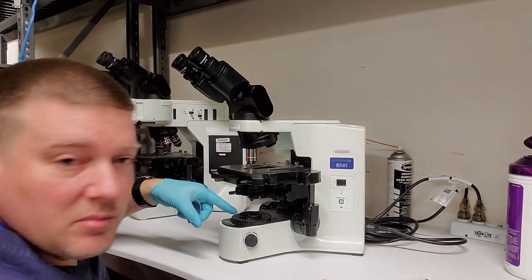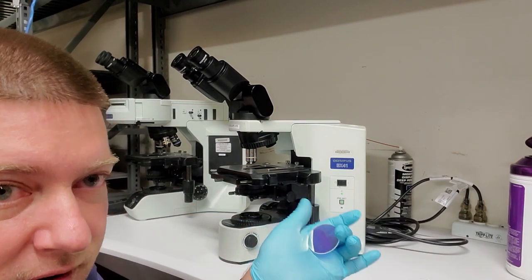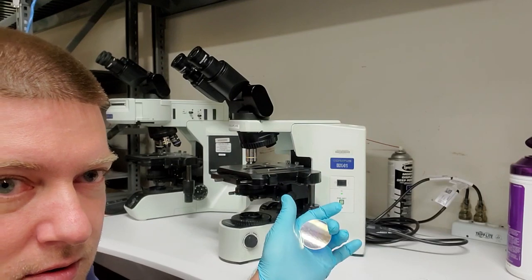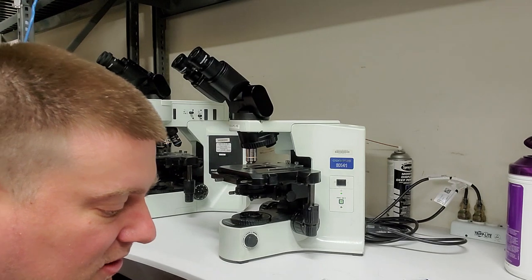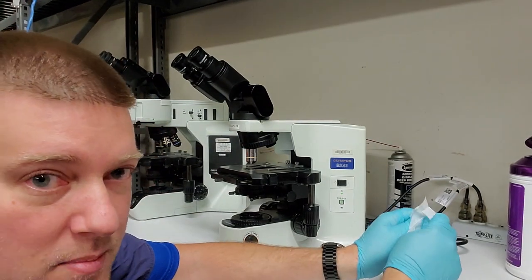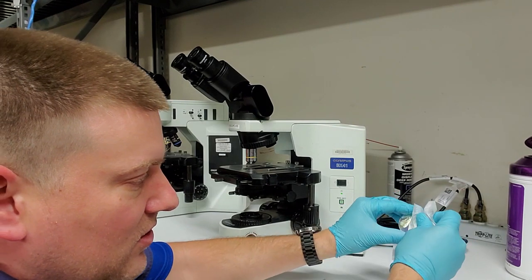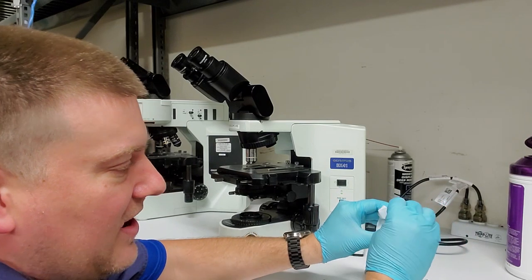Okay, I do see a little bit of a burn mark on the glass on the inside. And this guy here is very dirty. You're getting that much reflection because it's got a lot of dirt and grime on it. So I'm going to encase it in my wipe and just slowly clean off those surfaces. Do not scratch this guy.